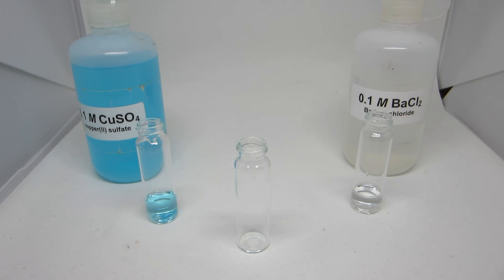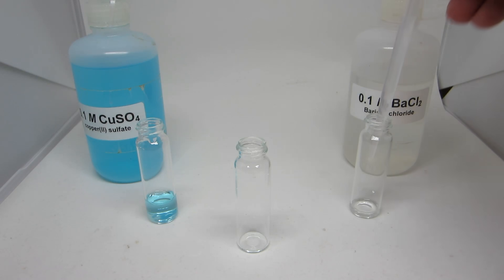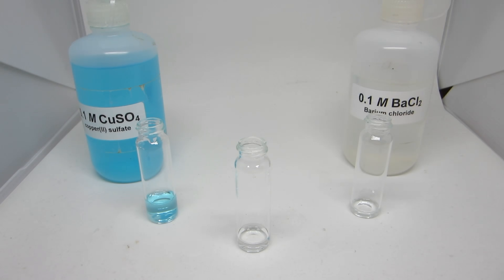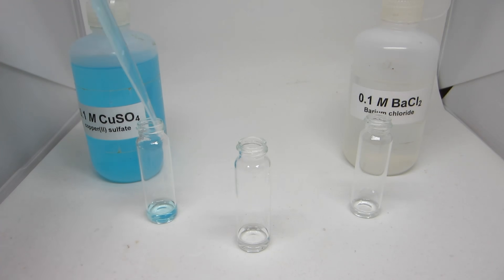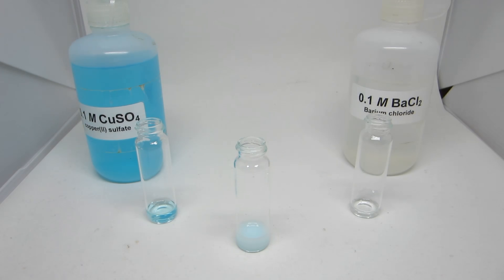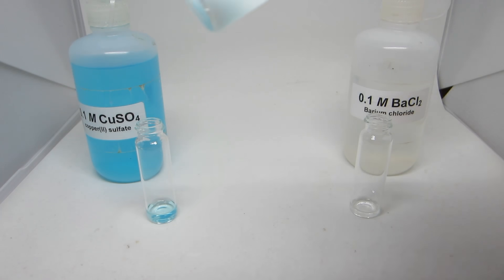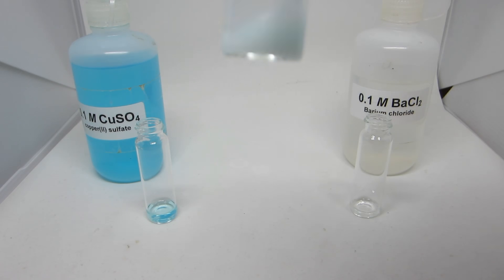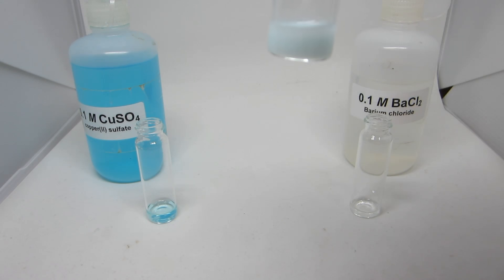The third reaction looks at the reaction between a clear and colorless barium chloride solution with the blue solution of copper sulfate. When the two react, a cloudy solution is formed indicating the presence of a precipitate. In this example, the precipitate is a white powder while the blue solution is still present.